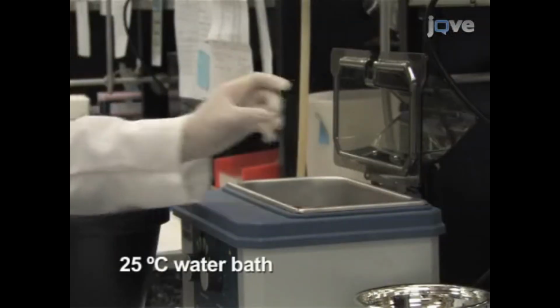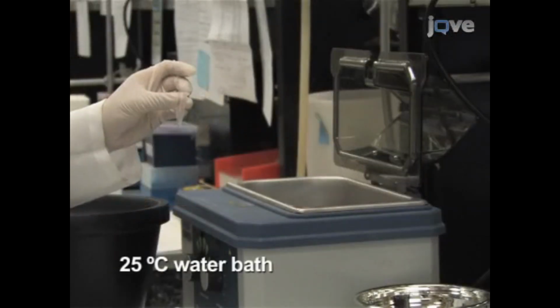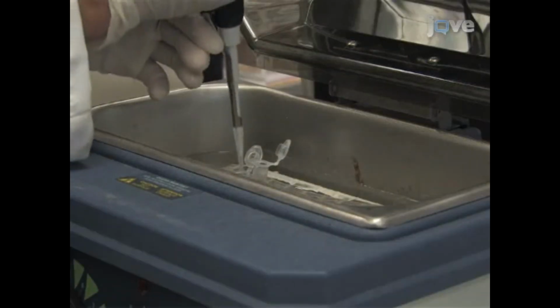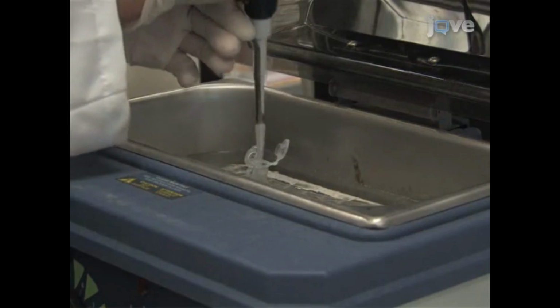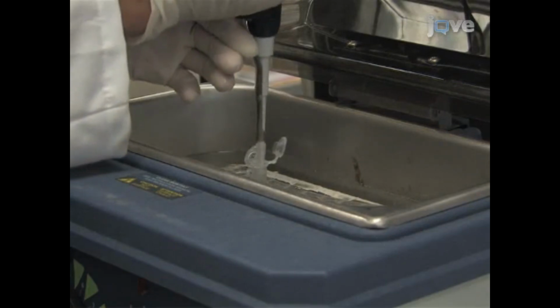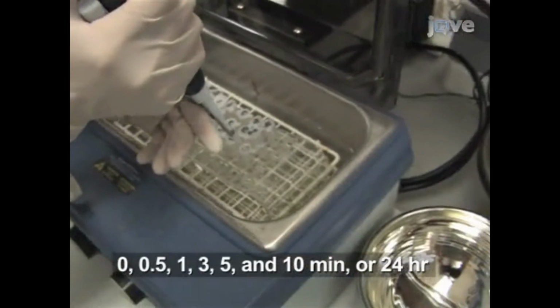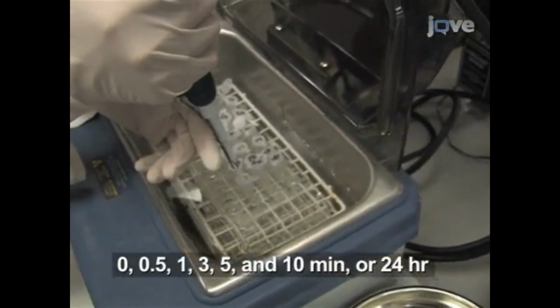First, equilibrate all solutions and reagents for hydrogen-deuterium exchange. Initiate the hydrogen-deuterium exchange by adding 18 microliters of buffered D2O to 2 microliters of 10 mg per milliliter Pak2. Perform reactions in triplicate over a time course.